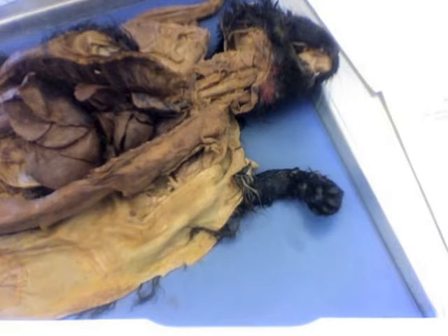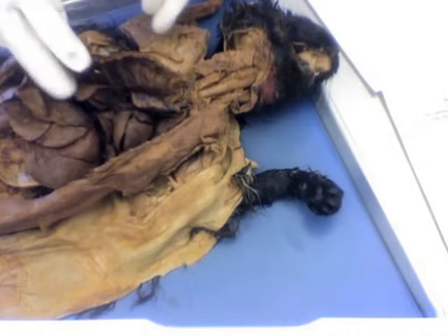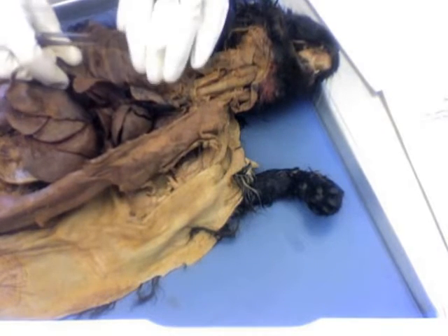Okay, lab number 6, the circulatory system. I'm going to go over a few things on the cat, and then we'll take a quick look at a model of the heart. So, external anatomy of the heart.